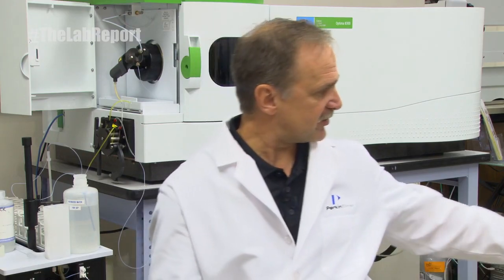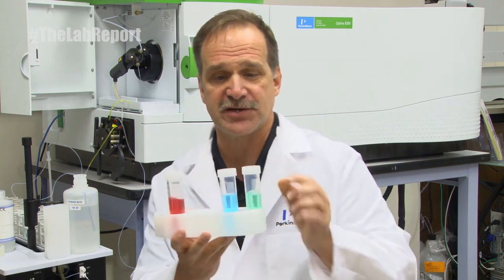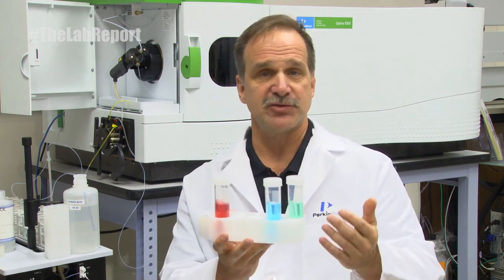The next thing to worry about is all these different elements in solution — whether it's copper, nickel, iron, cobalt, or chrome — you can have a very complex spectrum. For example, just iron has thousands of emission lines itself. Add in chrome and nickel and others that have a lot of emission lines, and very soon you have an incredibly complex spectra.